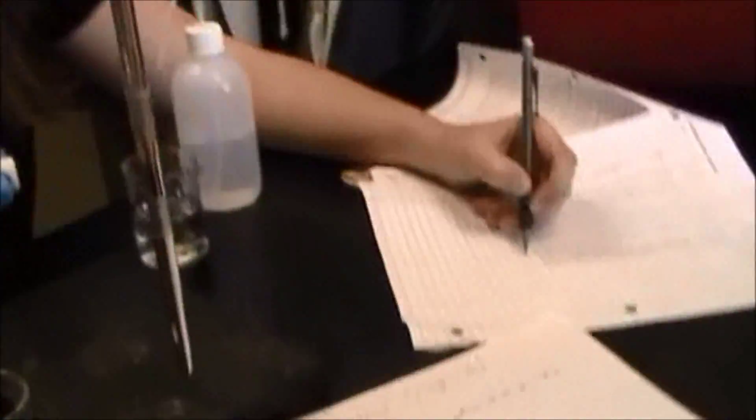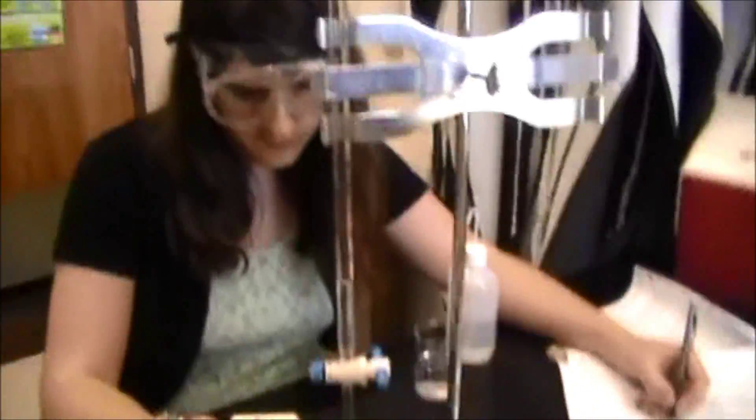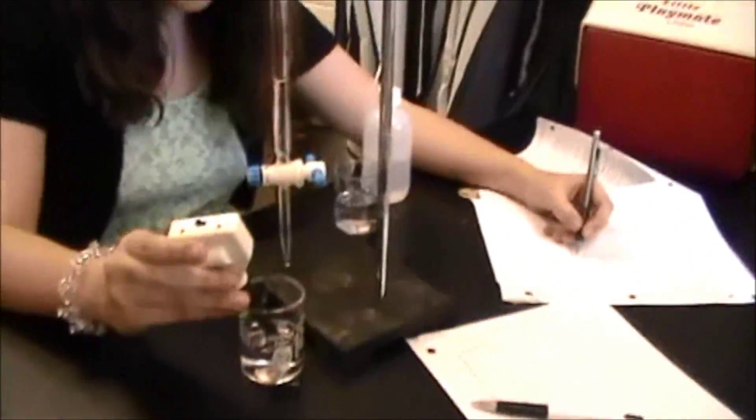We finished up with the acid, and we've cleaned all that stuff away, and we had really good data for that. And now we're working on when adding a base to the buffer solution.